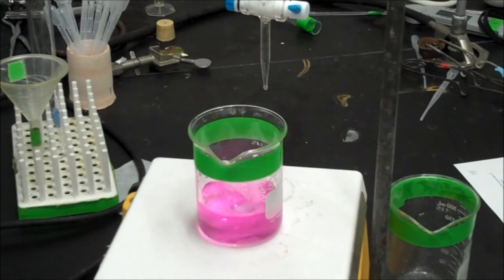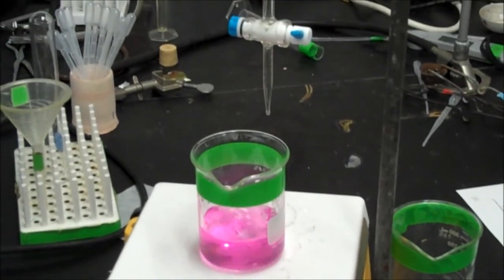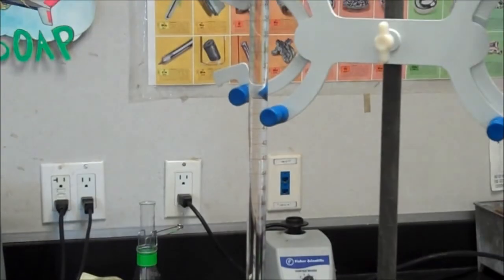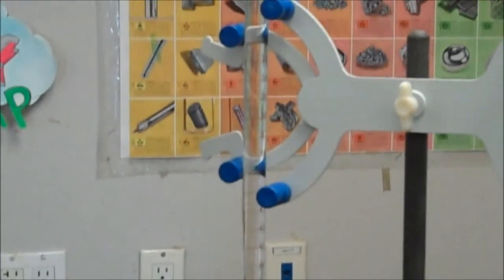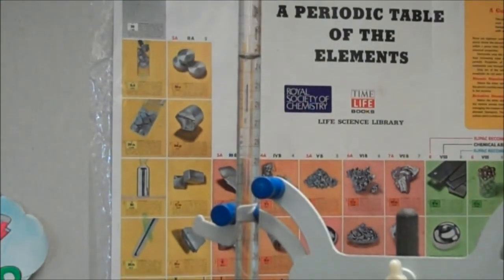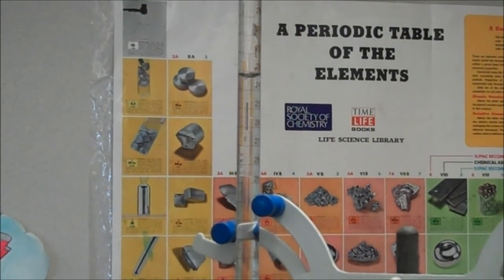I now need to read the volume. How much base did I use? So I go back up to my burette and I read the volume. Right there's where it's at. I read the volume.